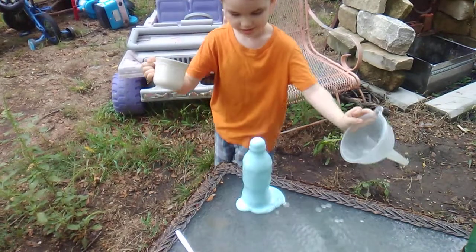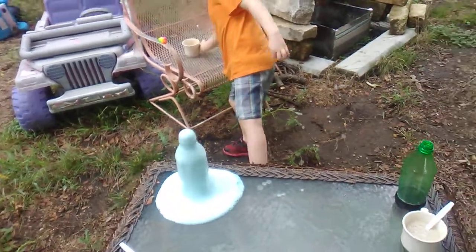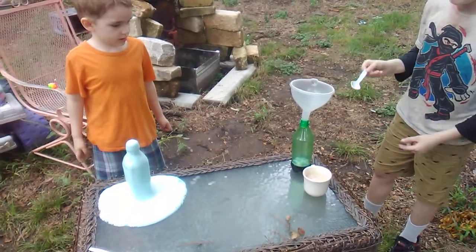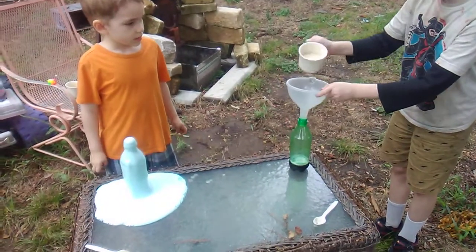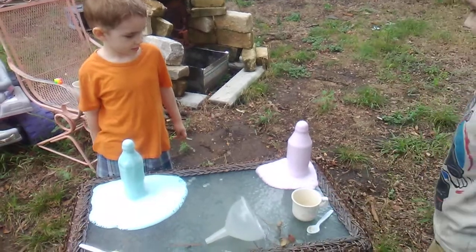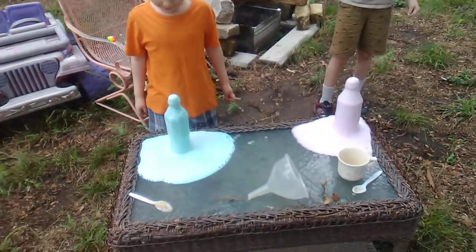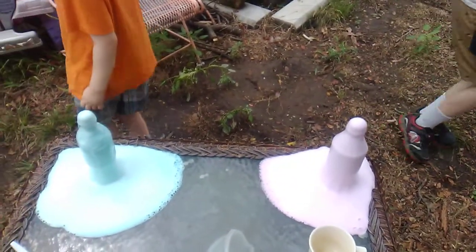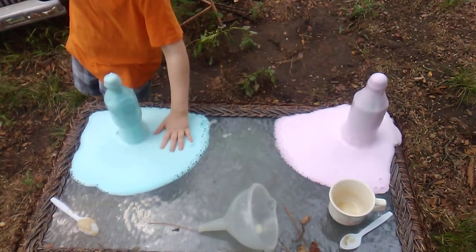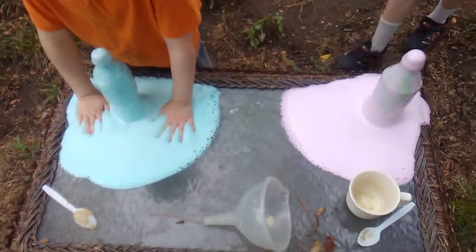We're out of the funnel — let's wait, give it a minute for the bad stuff to calm down. Okay, you can go and do yours if you want. It's gonna be there, let's go. Is it hot or has it cooled off? It's not gonna get that hot, it's just the yeast reacting.